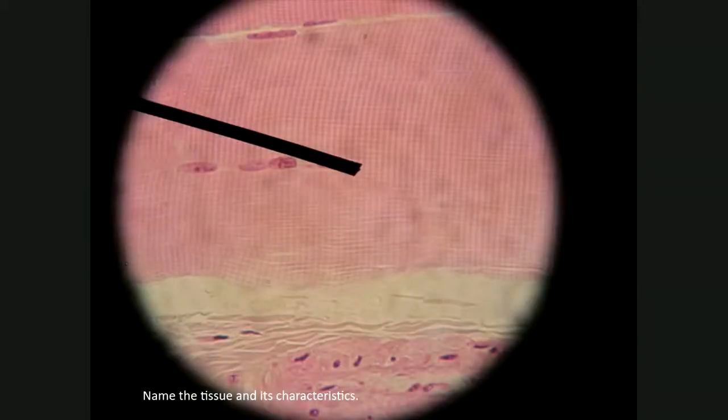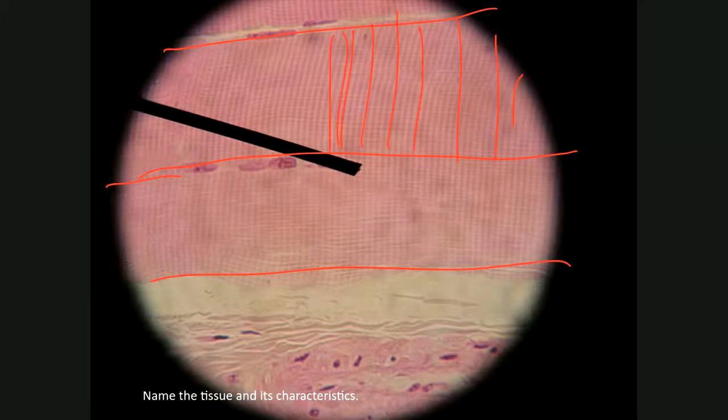I think hopefully what catches your eyes, first of all, if this is a cell here, and this is another cell over here, this is a humongous cell. It takes up the entire field of view pretty much, and we don't even see the complete cell. The striations are pretty obvious. That's a giveaway that this is muscle. Cells are elongated, another giveaway that this is muscle.